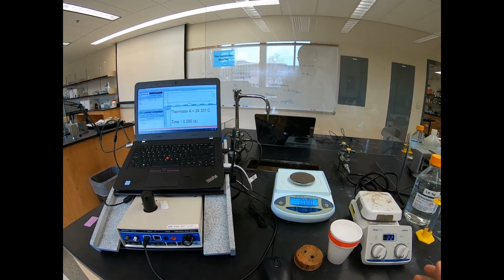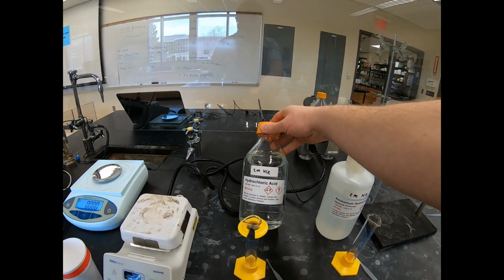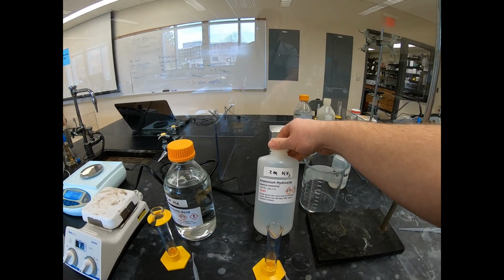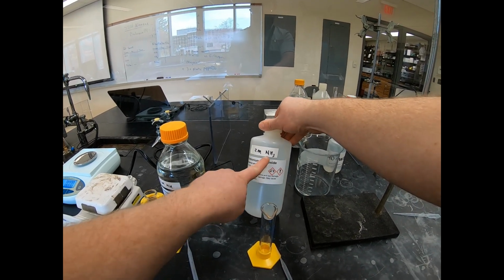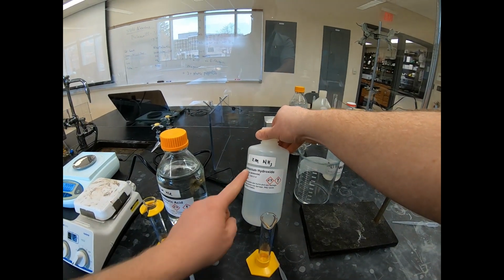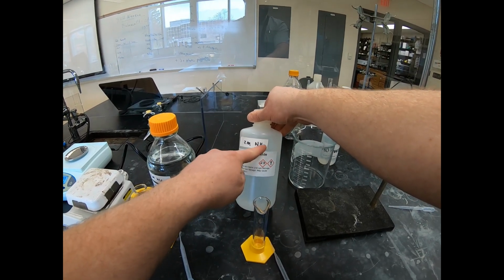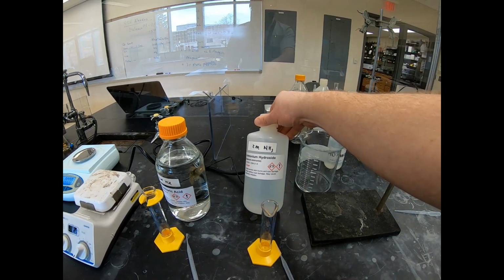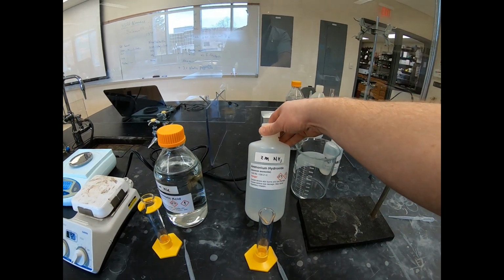Okay, and then this time, instead of having hot water and cold water, we are now going to be reacting 2 molar hydrochloric acid and 2 molar ammonium hydroxide. One note, ammonium hydroxide is really just ammonia dissolved in water. So if you think about NH3, it's polar, it's attracted to water, which is also polar. And so NH3, if you add H2O to it, you end up with now 4 H's on the ammonium with an OH on the end. So ammonium hydroxide is simply NH3 plus H2O. Okay, so that's why ammonia in water is the same thing as ammonium hydroxide. Okay, hopefully that makes sense.